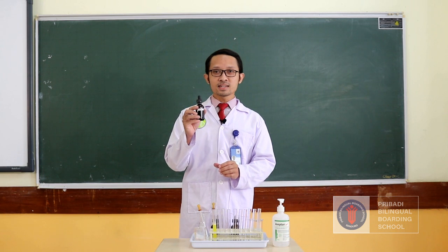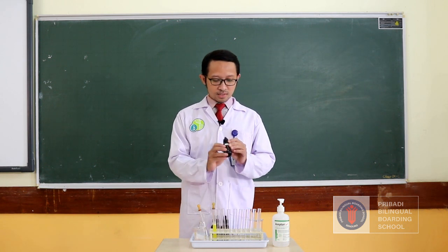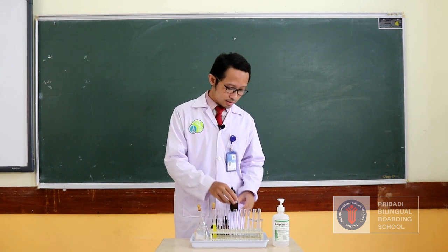The function of Benedict is to test the presence of glucose in a food sample. And the function of Biuret is to test the existence of protein in a food sample. Now let's take a look.